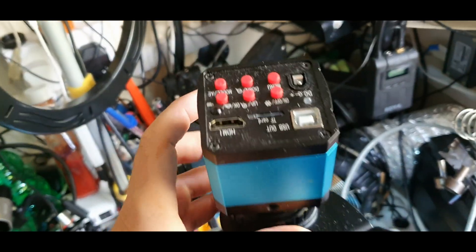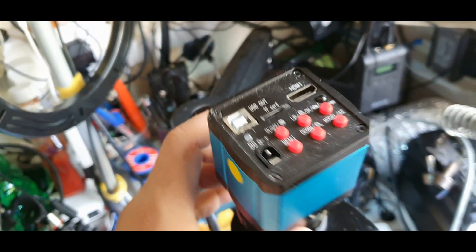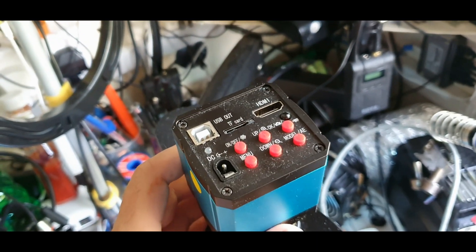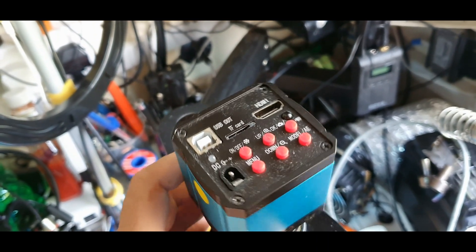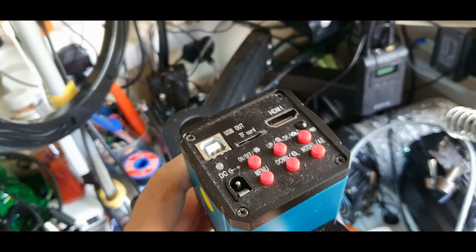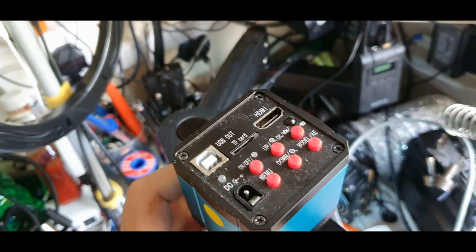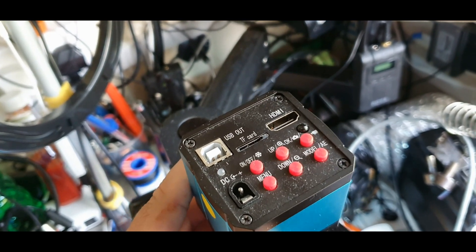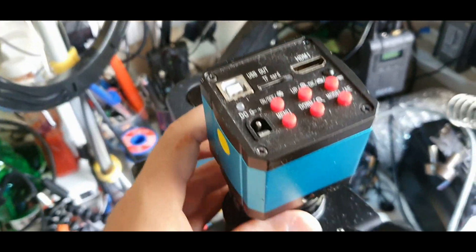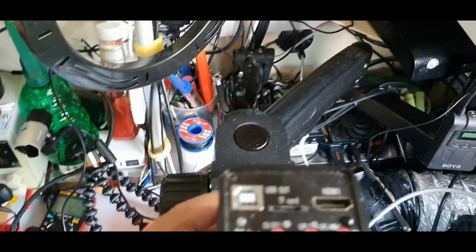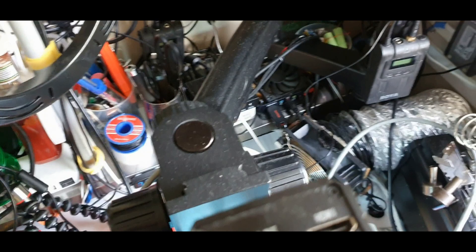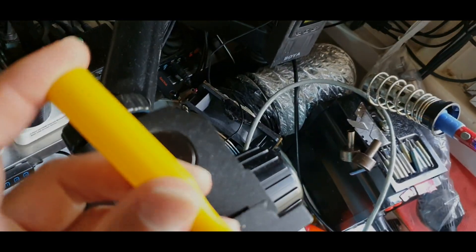Next one. Next one, straighten out. Just doing that a little bit more. Must be that straight. Just tighten this up now down here.